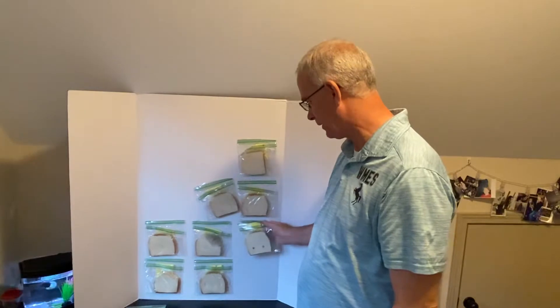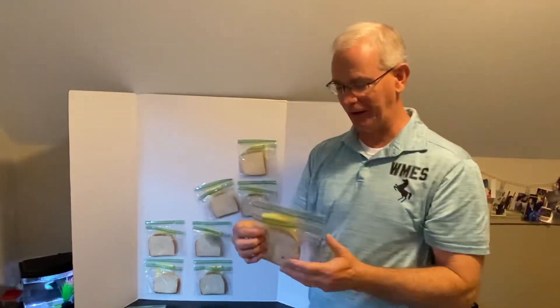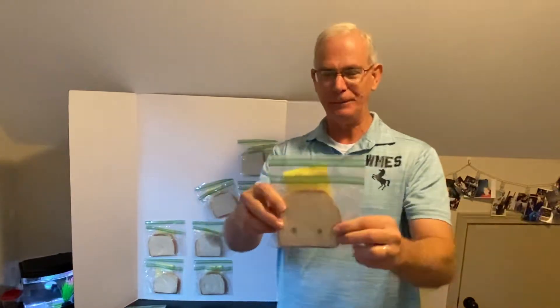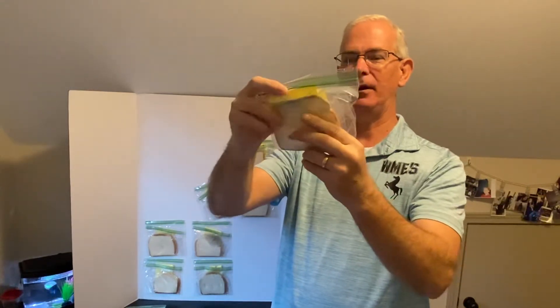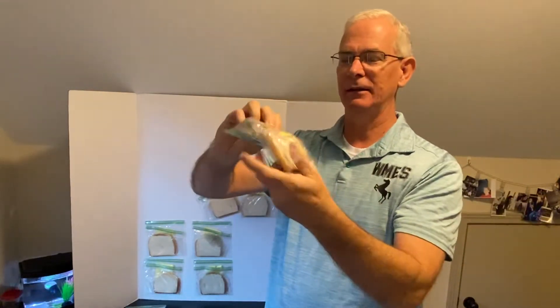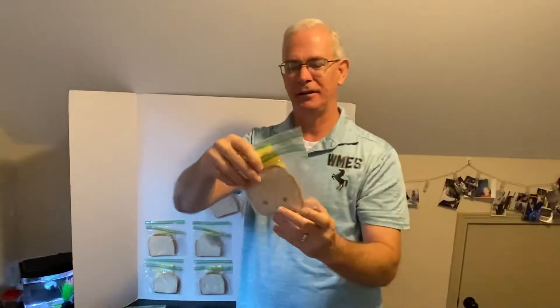This next one, I'm going to kind of unclip it here. This one fascinates me — it looks like two eyes. I'll hold it up there for you to see it. You see it right there. And then on the back, look at that right there. Take a guess and think about where they contacted that piece of white bread.